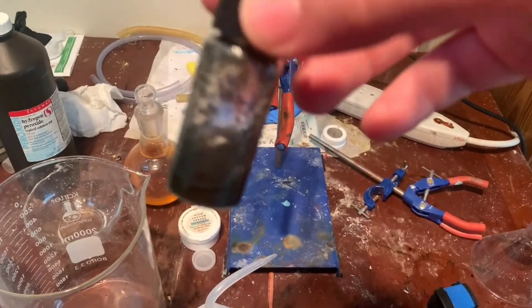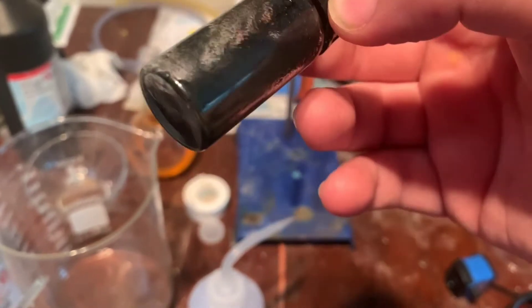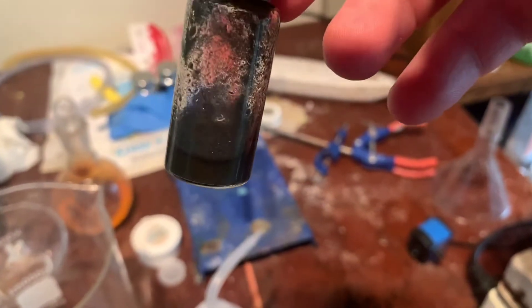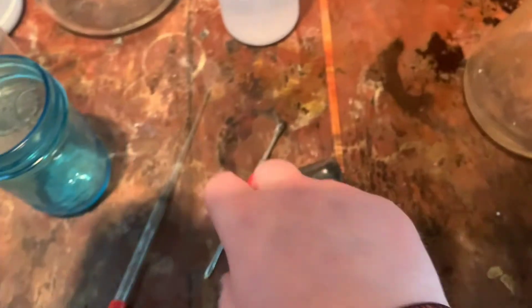And here is the iodine. This is the iodine we got — it's still underwater. It's a high yield because, you know, elemental iodine, just oxidizing it with hydrogen peroxide. Good yield.